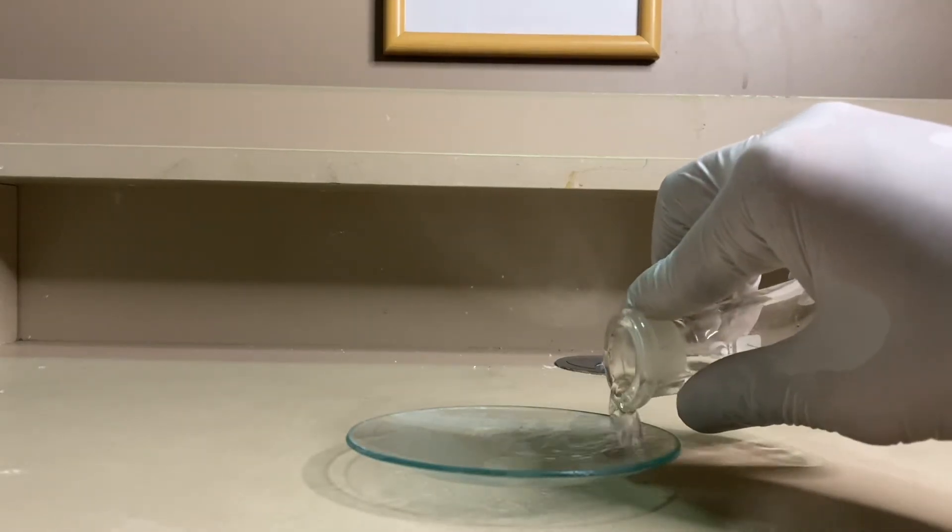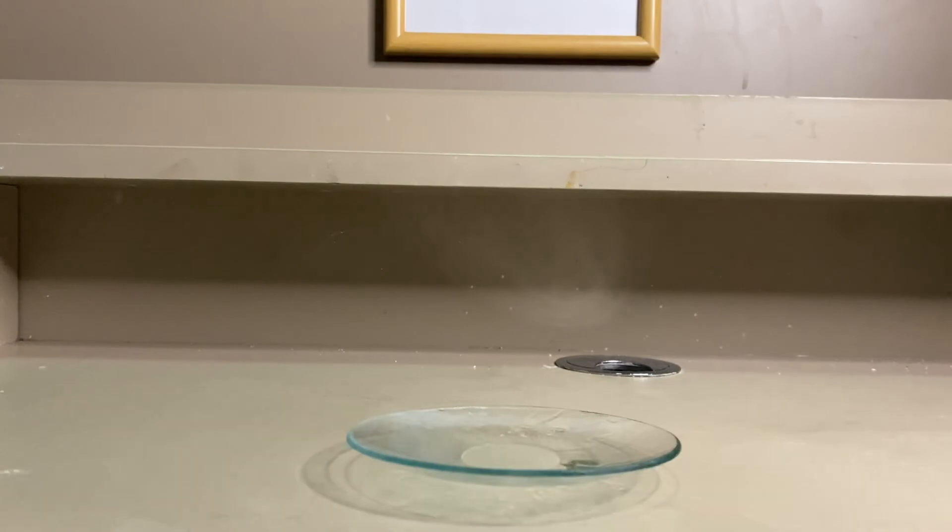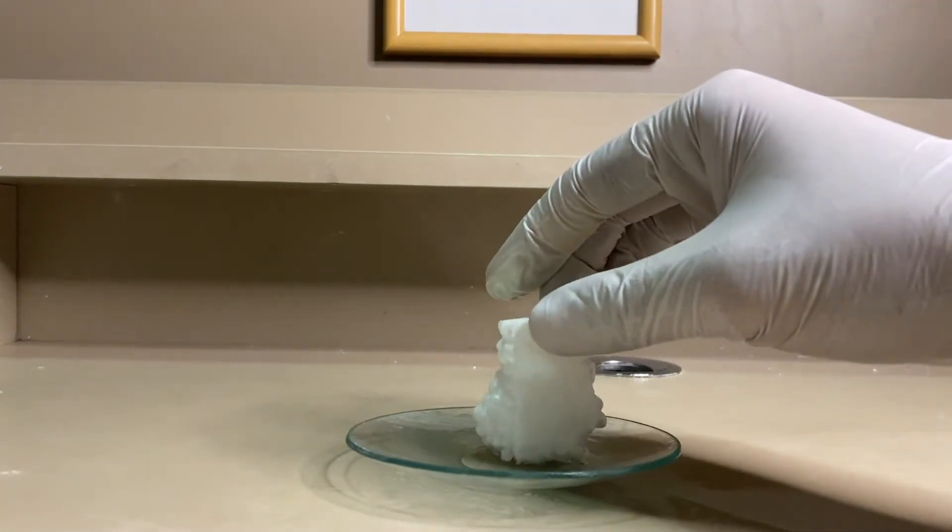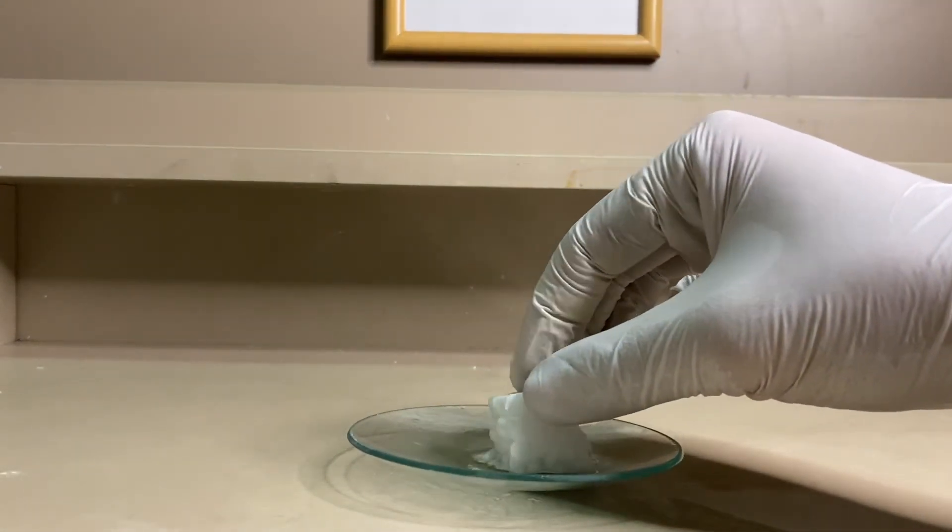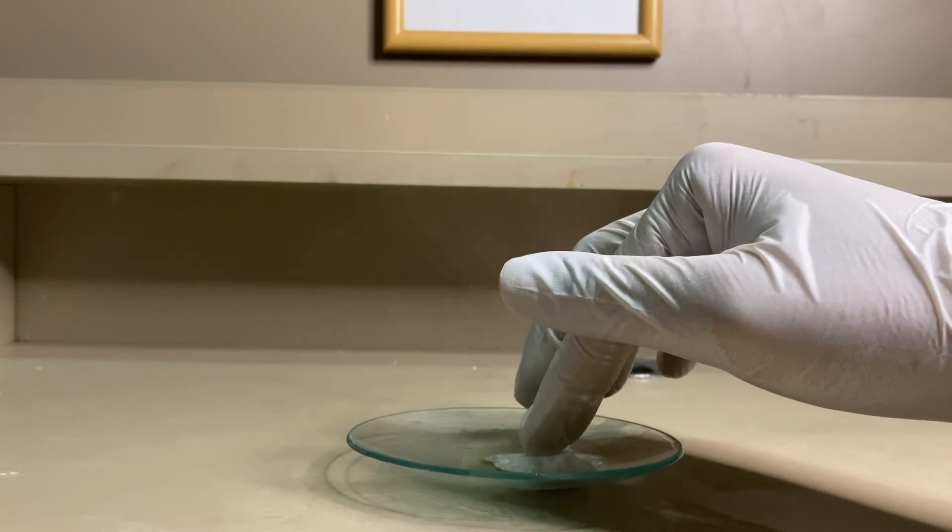And that is our product. So what do we do with acetone? One of the funnest things we can do with acetone is to dissolve styrofoam. A very small amount of acetone is able to consume styrofoam of many times its volume.